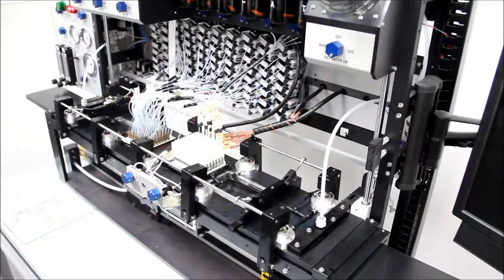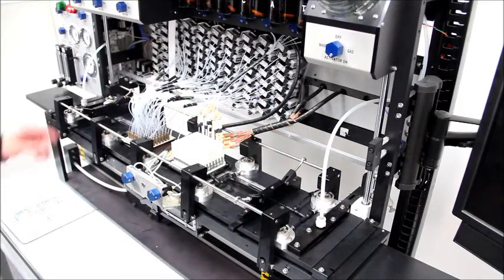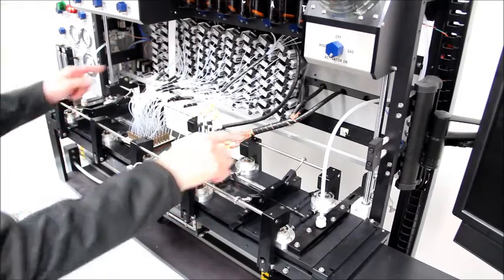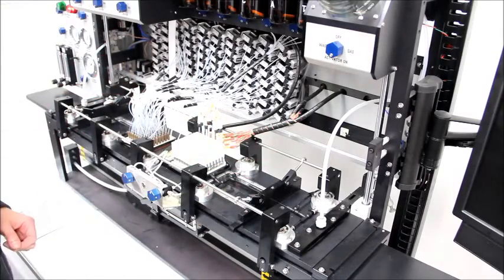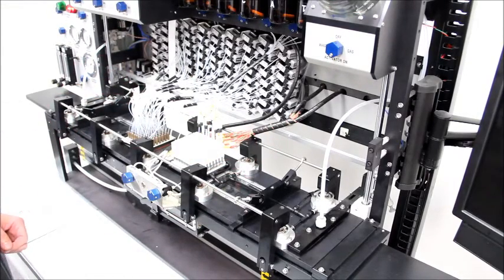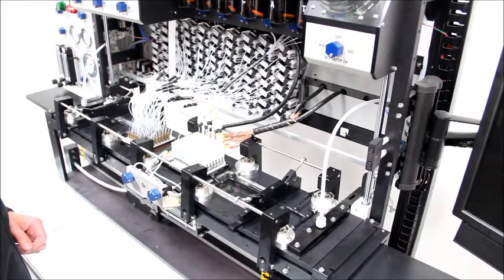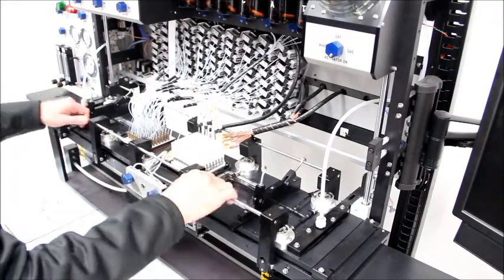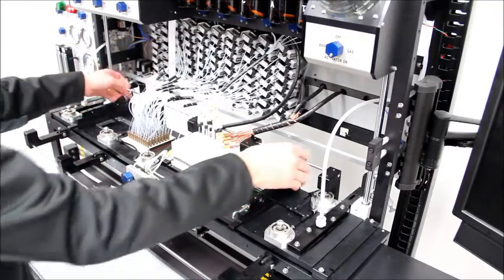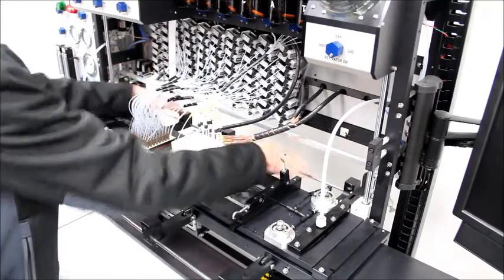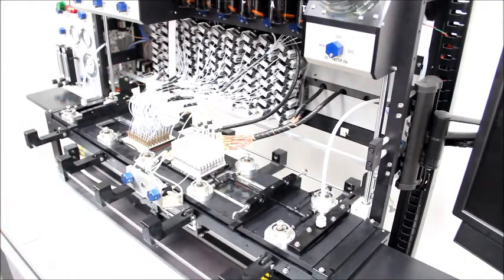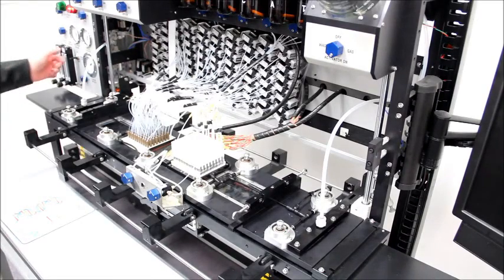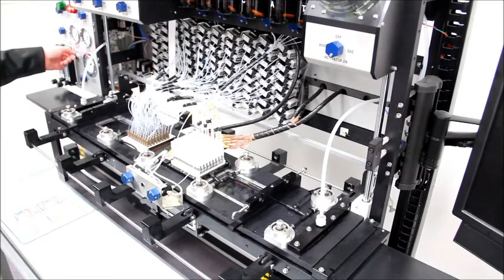The reaction chamber is sealed using clamp arms located at the front and rear of the nozzle plate. To open the reaction chamber and access the reaction plates, release the clamp arms and raise the nozzle plate using the nozzle plate switch located on the control panel.